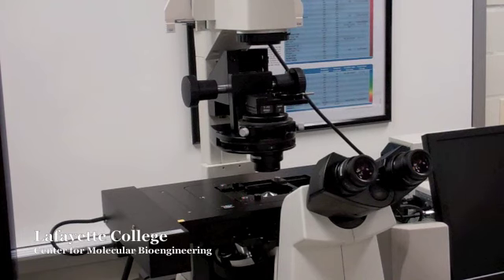Before optically focusing a fluorescence image on the confocal microscope, you need to focus the image using transmitted light first. To learn how to do this, refer to the video on optical imaging.